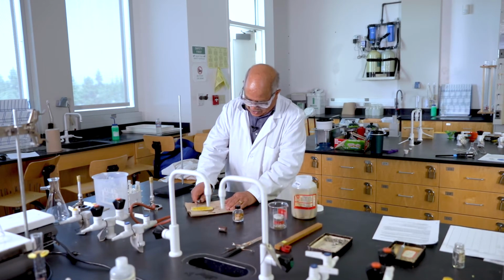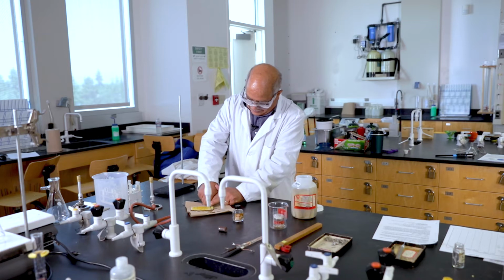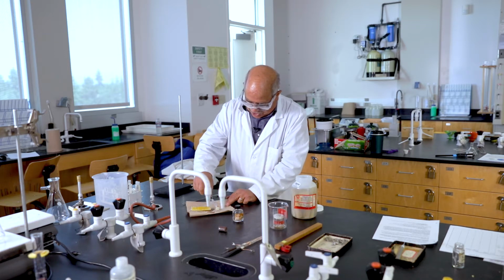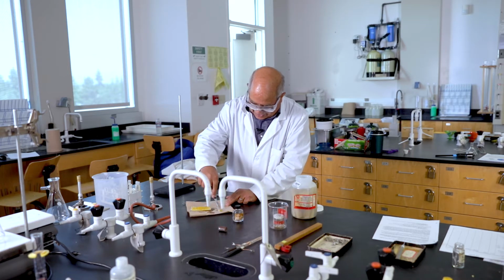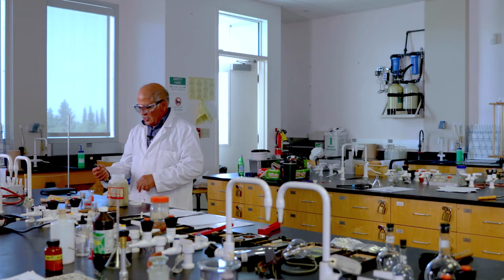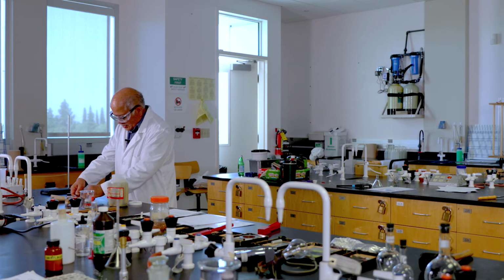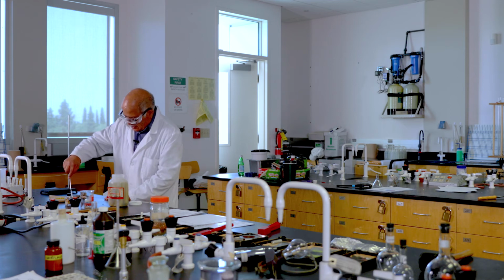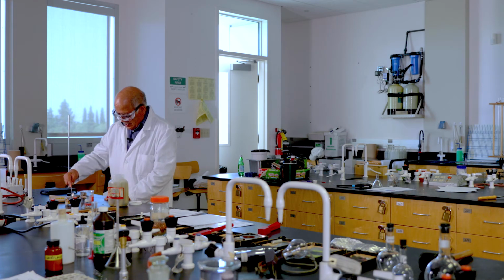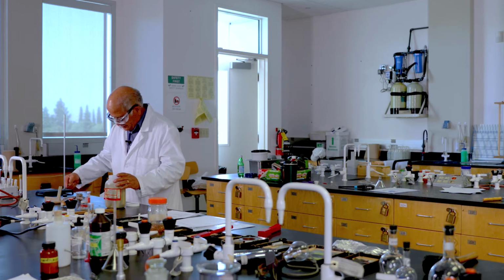Once the oil is removed and you cut it, you end up with this shiny surface. It's a soft element. It's a very good conductor of current as well. So sodium must always be kept under oil to protect it from moisture and air. And put it back here.